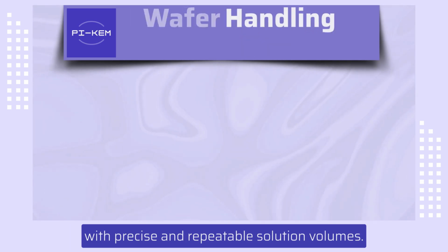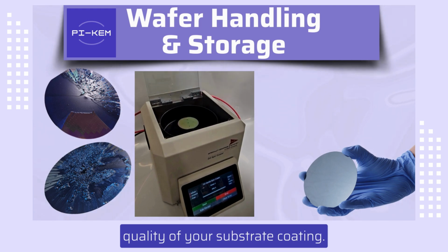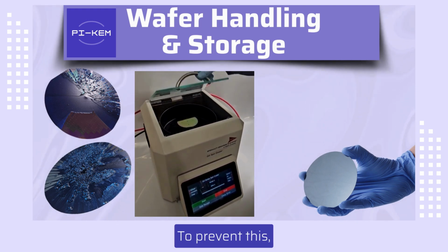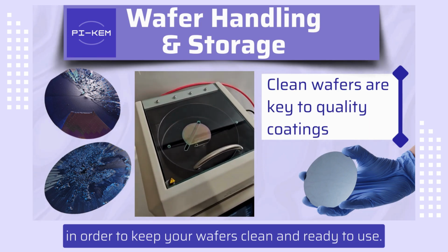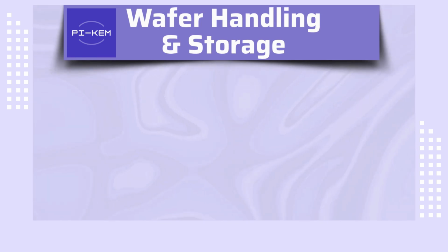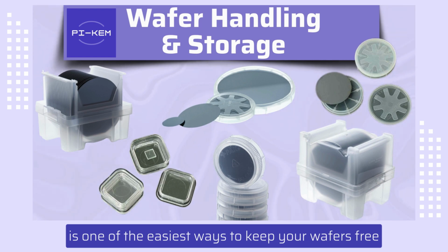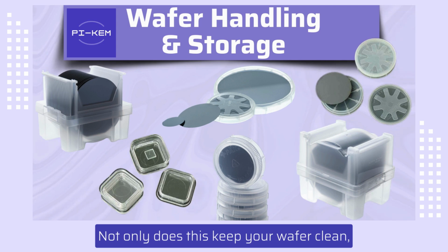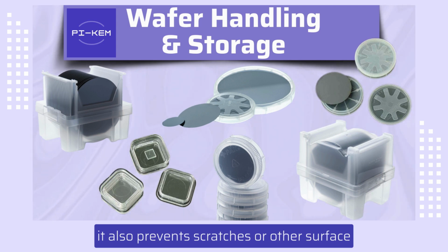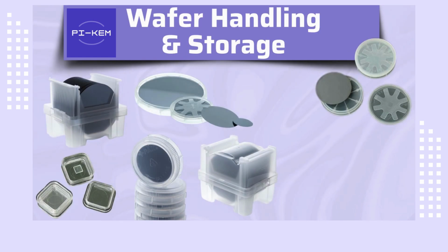As we've seen, contaminated wafers can severely impact the quality of your substrate coating. To prevent this, there are several techniques that you can utilize in order to keep your wafers clean and ready to use. Storing your wafers in specialized containers or cases is one of the easiest ways to keep your wafers free from contamination. Not only does this keep your wafer clean, it also prevents scratches or other surface damages, overall keeping fragile wafers safe and secure, especially when being transported.